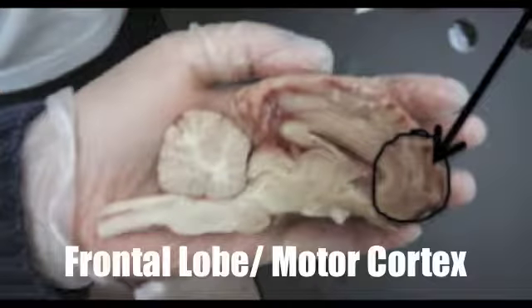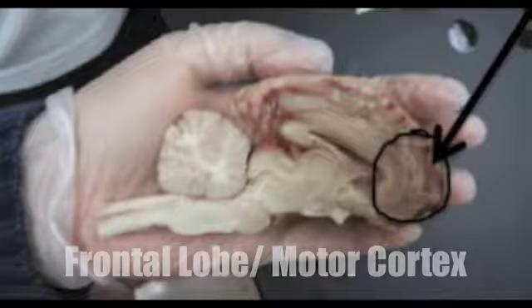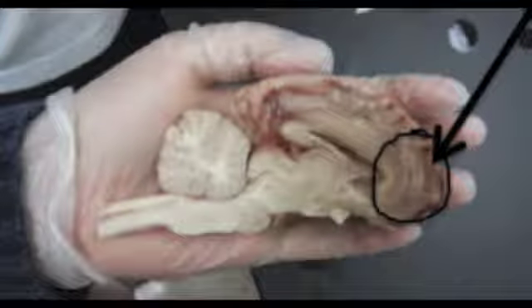The frontal lobe is located at the front of each cerebral hemisphere and is positioned in front of the parietal lobe and above the temporal lobe. The posterior border of the frontal lobe, the precentral gyrus, contains the primary motor cortex, which controls voluntary movements of particular body parts. The frontal lobe also contains most of the dopamine-sensitive neurons, which are responsible for reward, attention, short-term memory, motivation, and planning.